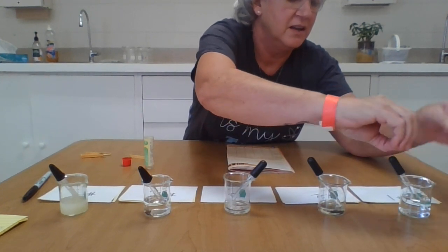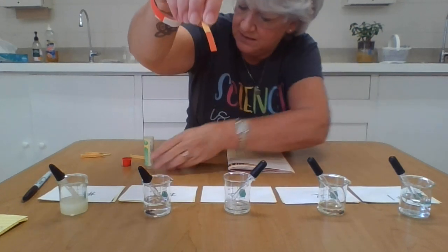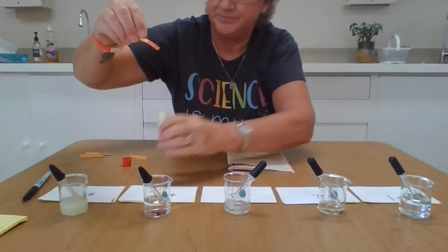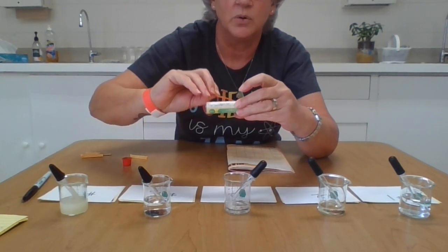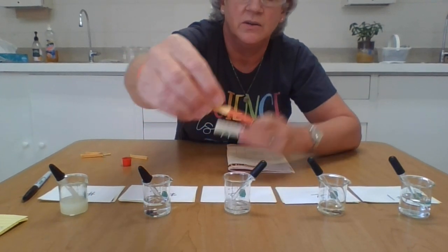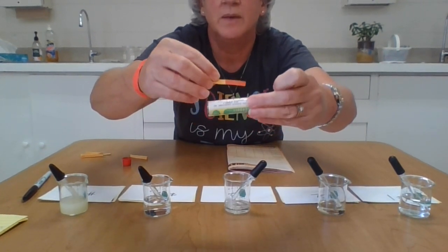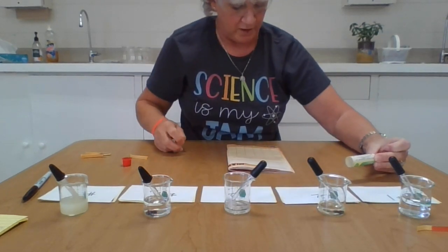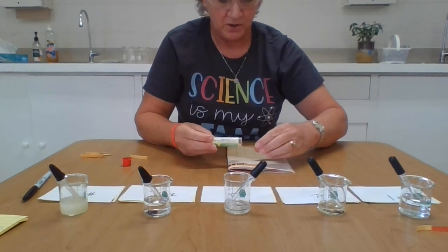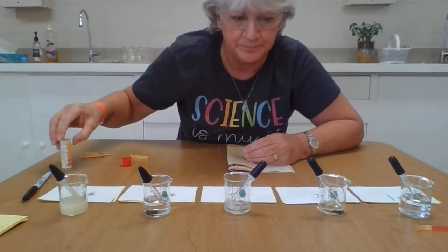Number 1 did an immediate turn like that. I'm going to match it up and say that it is a number 1 on the scale. You can see that on my testing paper there. Very close match to number 1. Okay, so you could say it has a pH of 1. So color of litmus paper, you can put red or bright pink.